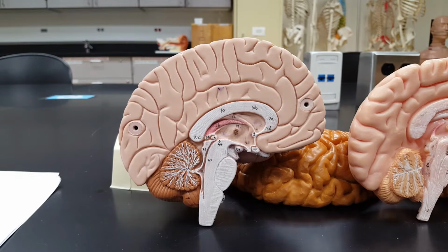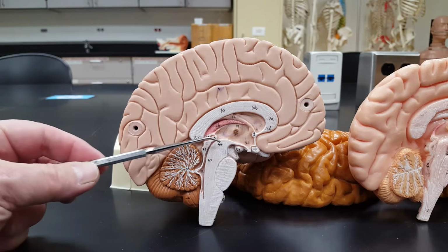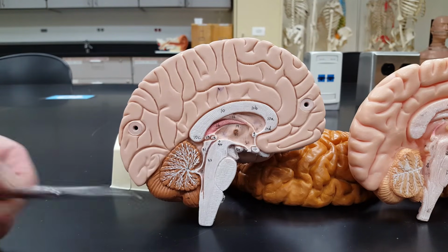And I will be jumping around a little bit between the left and the right-hand columns in your lab manual, but make sure that you're using those, again, very helpful diagrams that have been provided for you. I strongly suggest coloring those things in, labeling those things. We have all the numbered labels and everything that I went over with you in the introduction to this lab. So moving down in the left-hand column, we see the three-parted brain stem from here to here. So if I indicated this entire structure, that's the brain stem.